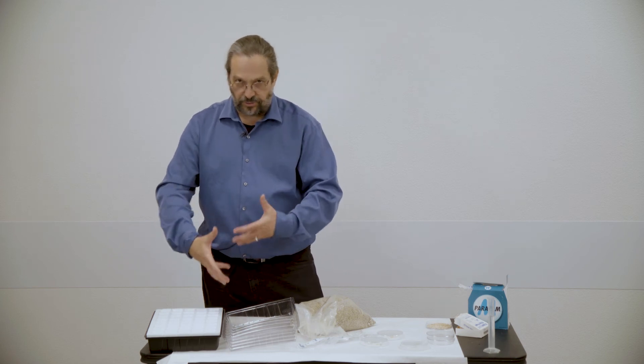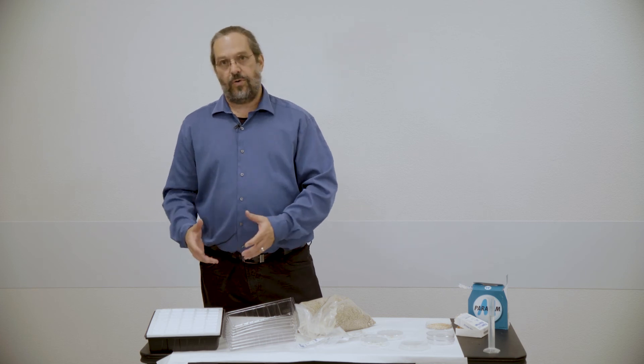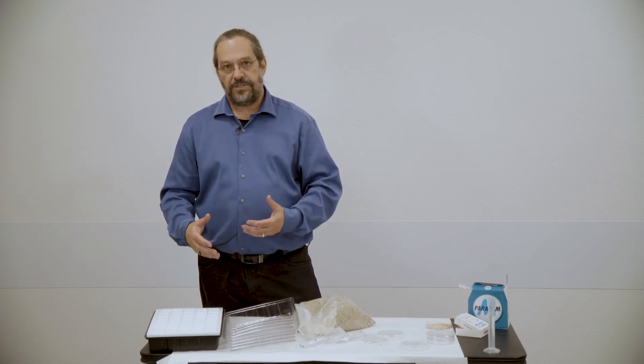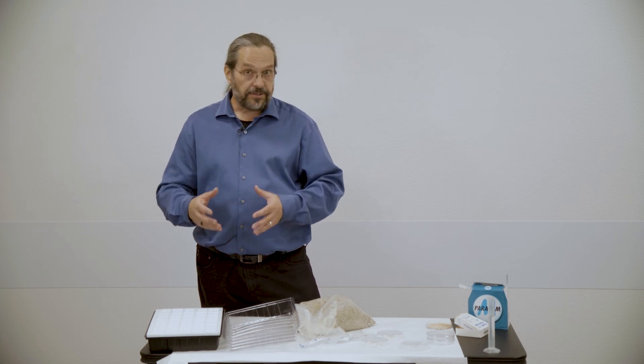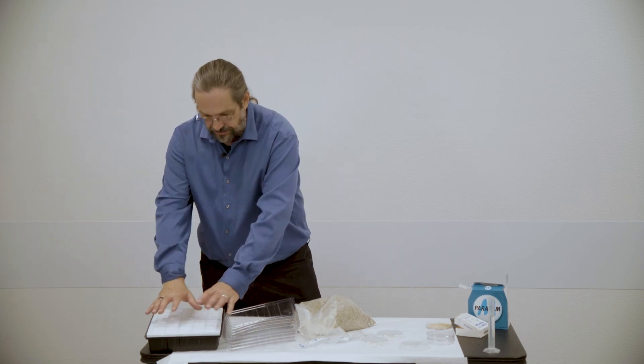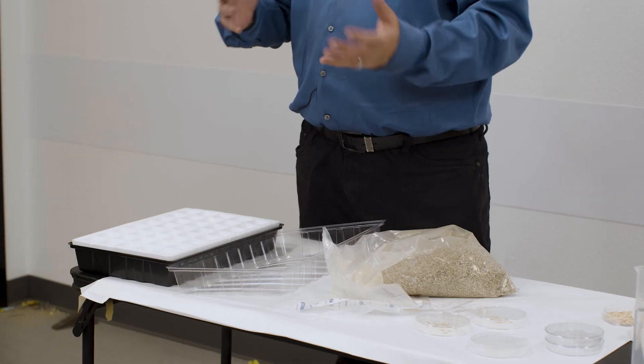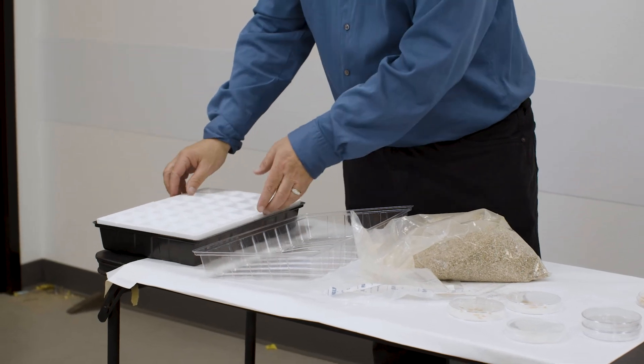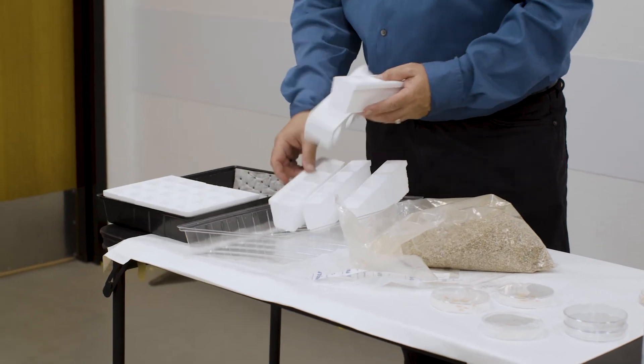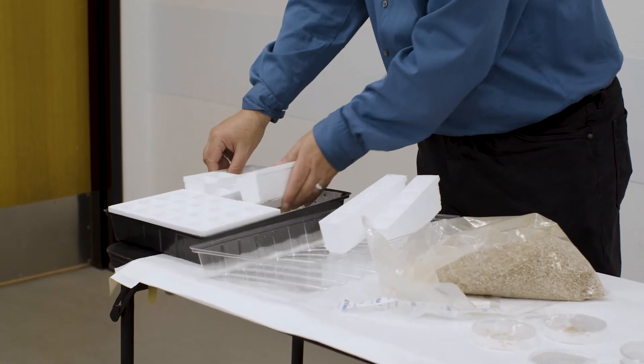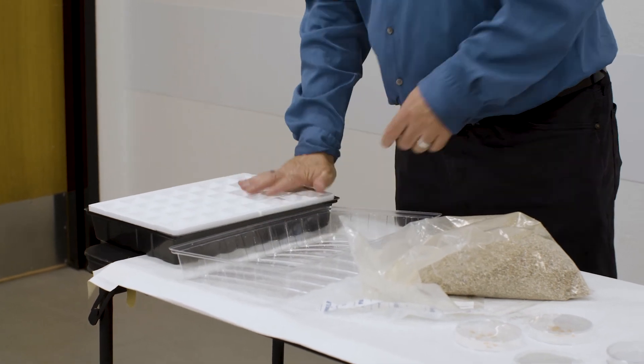So again, in this situation, you can go ahead and mix your soil. I didn't bring any out today because I don't need to make that big of a mess. But you can mix your soil. What a number of my students did is actually mix the contaminant of interest, in this case metals, into the soils, placing the soils in there. Obviously, you'd probably want to use the same level of contamination for each tray. So there'd be a problem of it mixing in. And especially given that these trays are designed to capture the water beneath and hold it there, which basically is a real advantage in terms of making sure that your plants don't dry out.